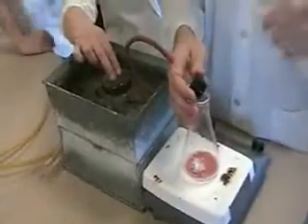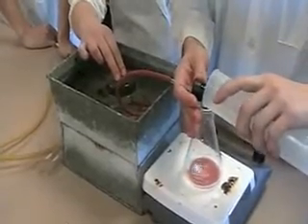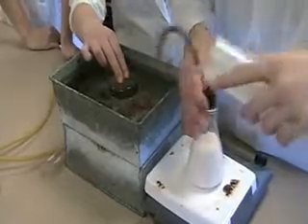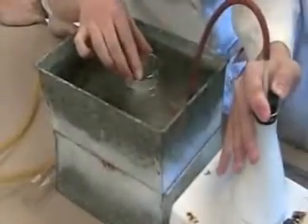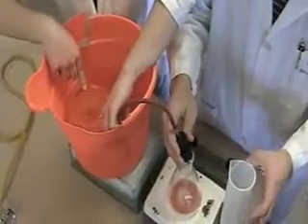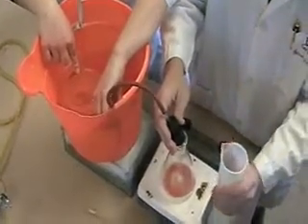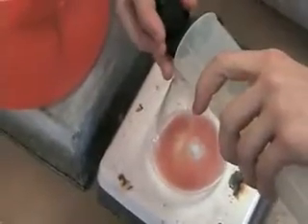Let's get this set up. So this is just regular liver? Yep, pureed regular liver. Cap it — oh, whoa! Why is this going insane now? So what are we looking at? This trial is acidic liver puree with hydrogen peroxide. The pH is 5.18.